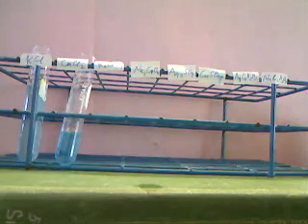So now we've combined all the solutions in that row on our table. Now I have to go down to the next row. And finally, we'll combine our last two solutions together. And there is our result. And so that's the final pair of our solutions.